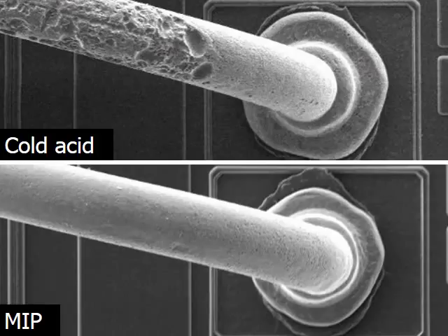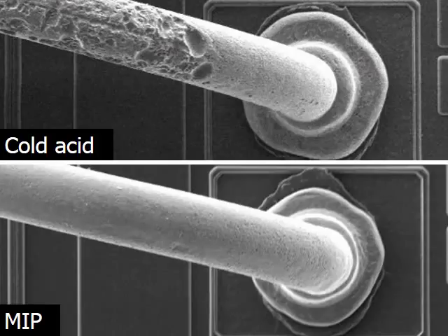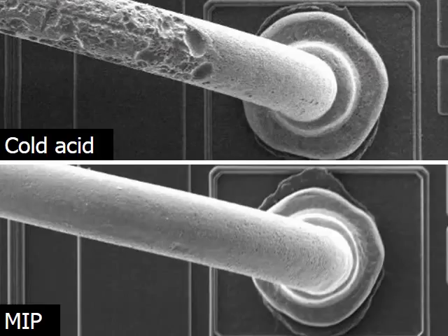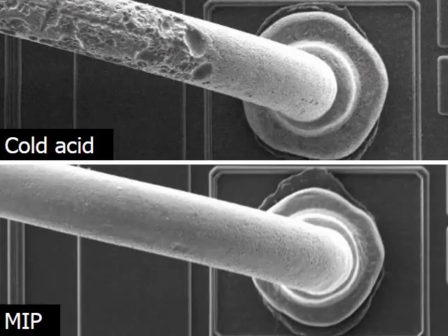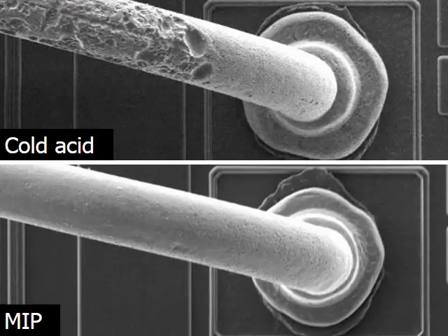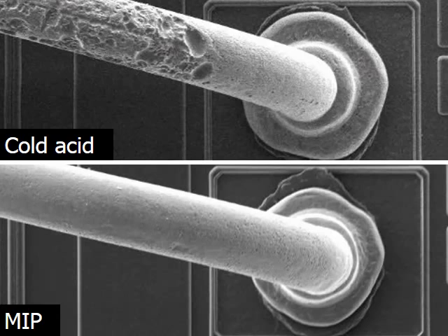By comparison, the MIP sample shows that the decapsulation process has preserved the surface details of the palladium coated copper bond wire, meaning that no process induced damage has occurred to the sample. The MIP decapsulation process has preserved the original failure sites and contaminants on the sample, enabling an engineer to undertake further analysis to uncover the true root cause with high confidence level and high reproducibility.